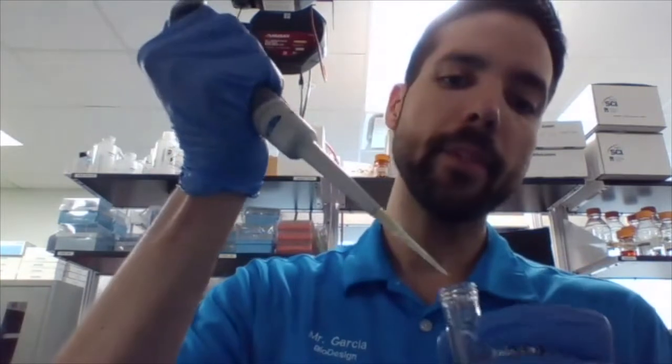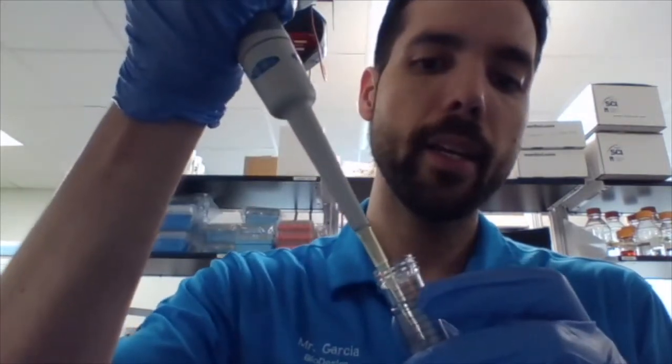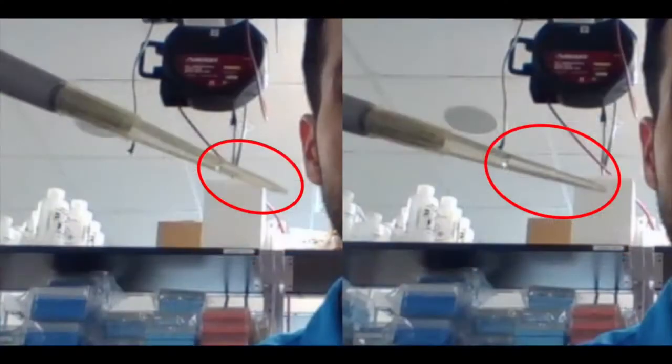Now, what happens if I had actually gone to the second level to pick that water up, and then I went ahead and I picked up water. You can actually see there's obviously a lot more water.